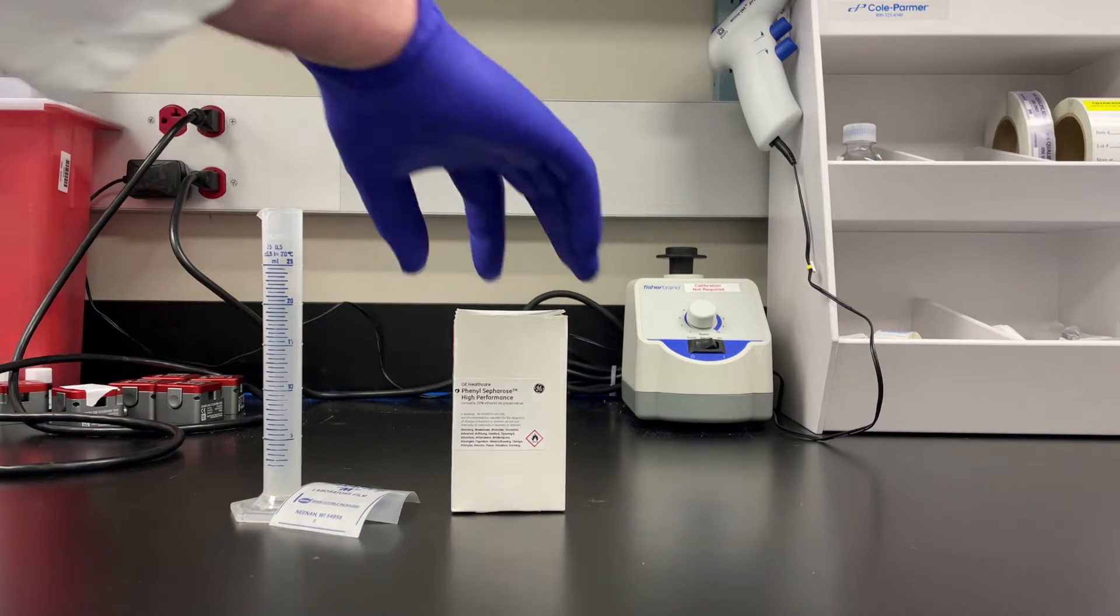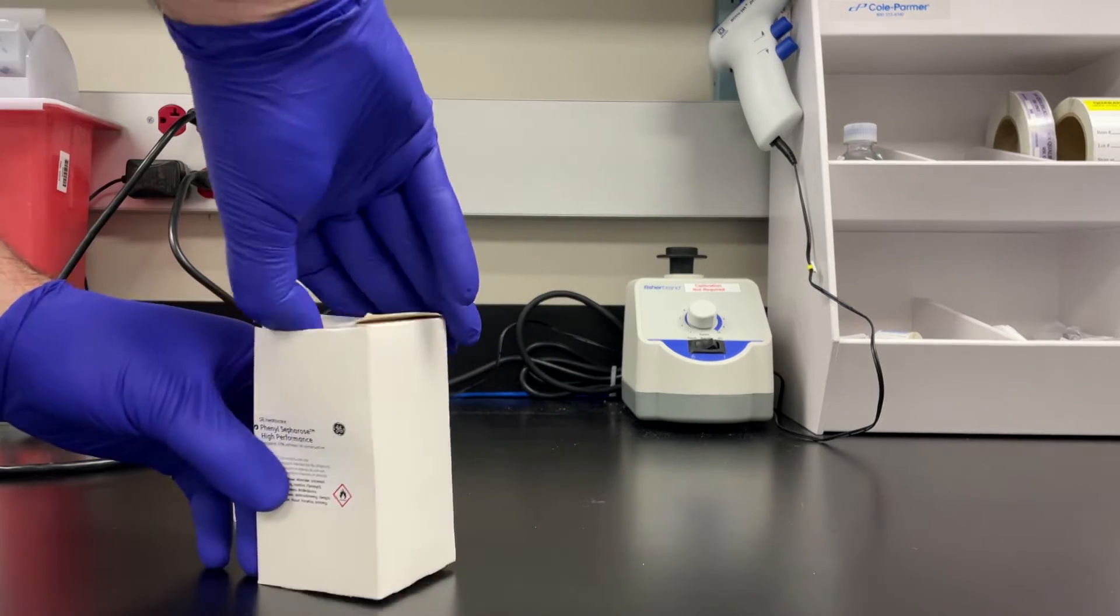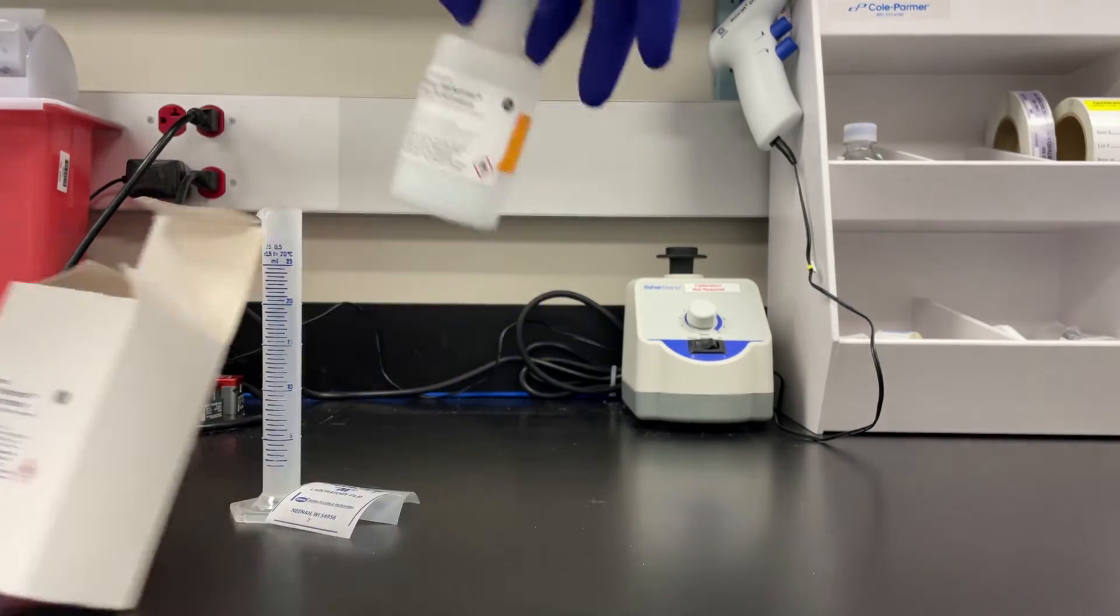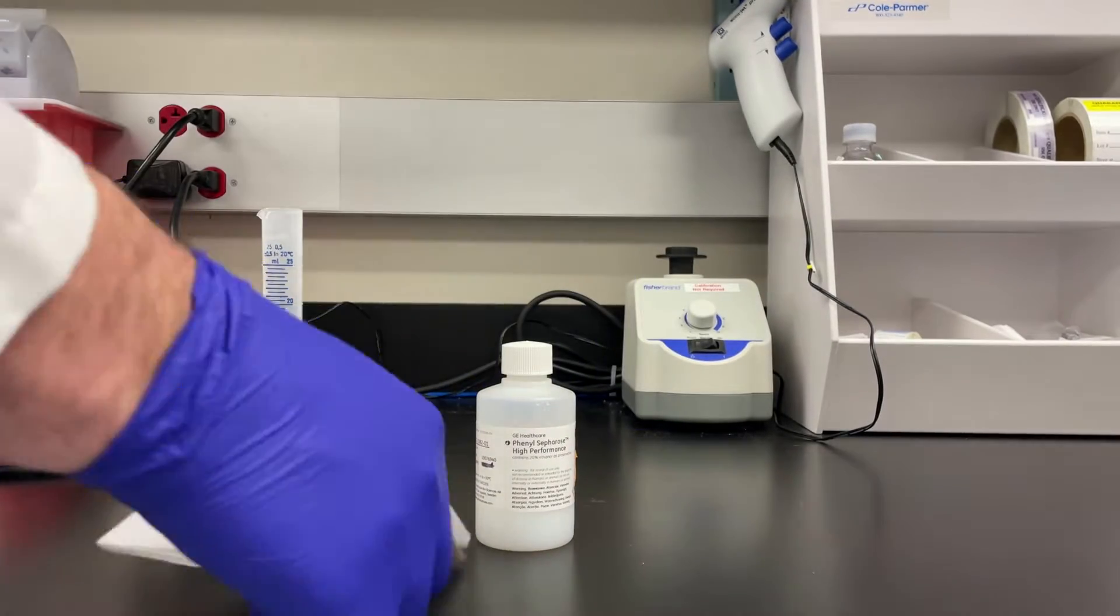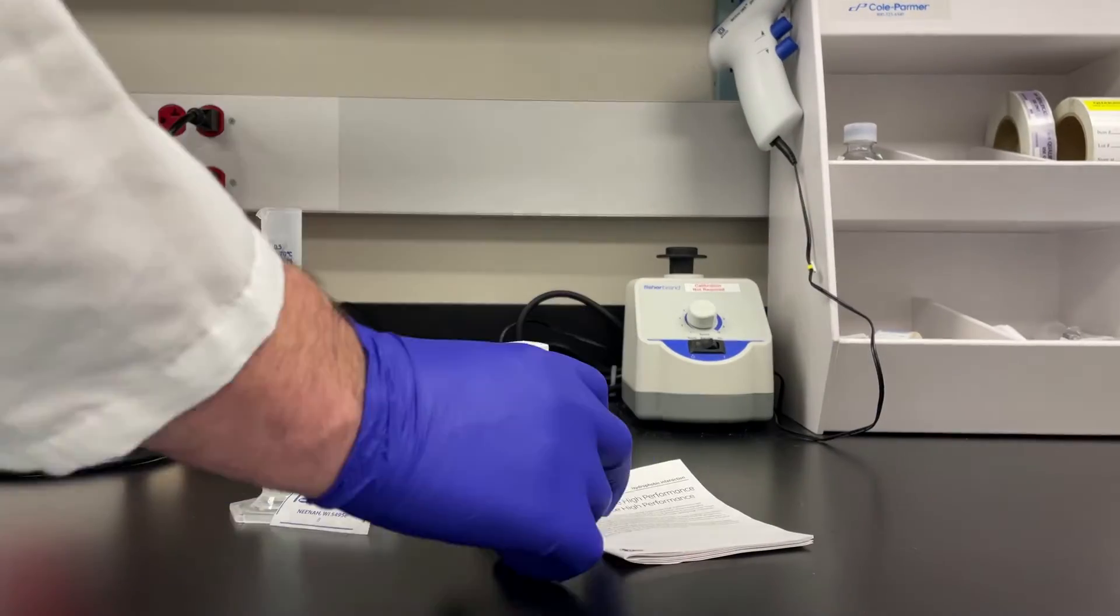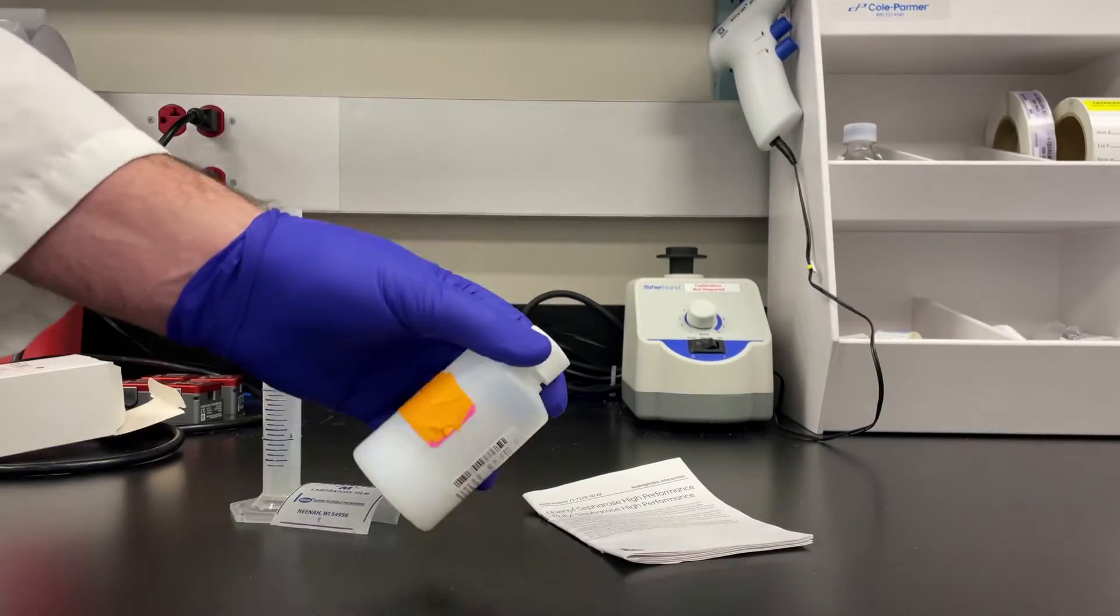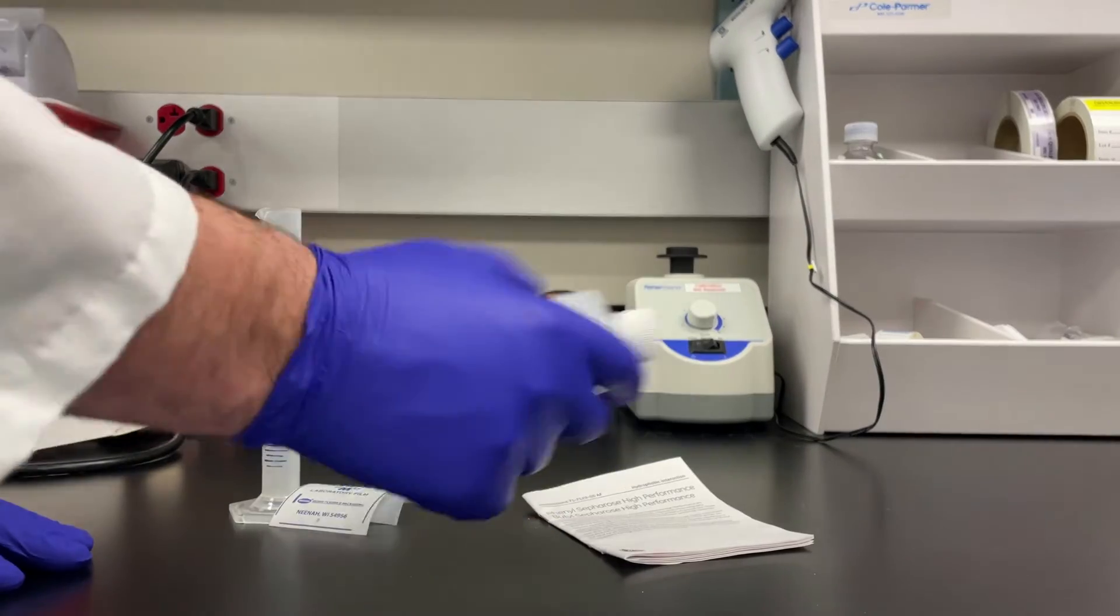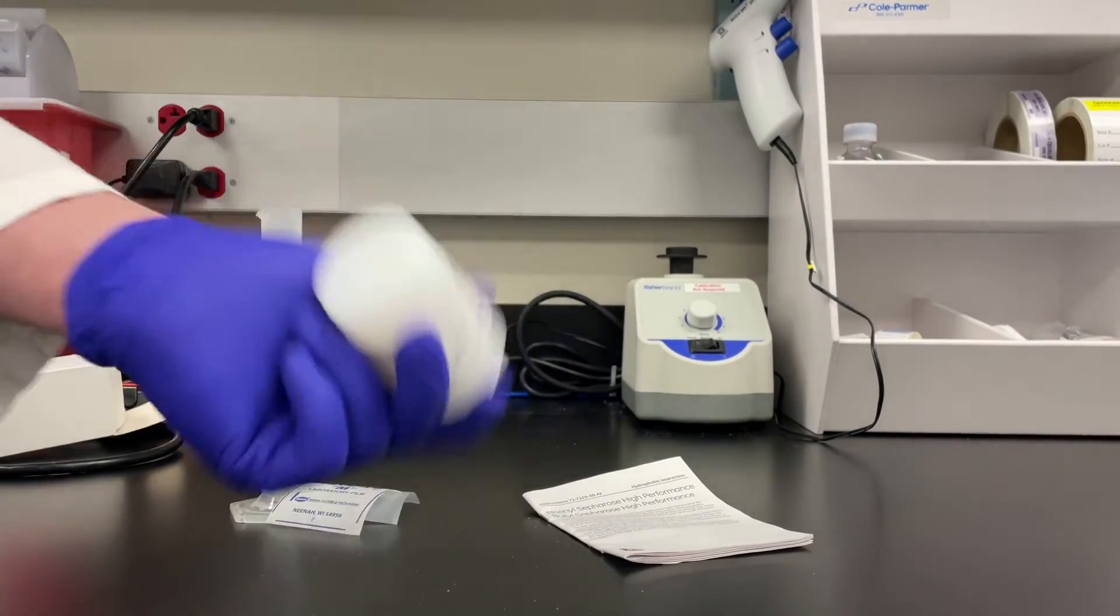This is the finished product. Alright, so the first thing we're gonna do is resuspend this resin. I happen to have a bottle of phenyl HP laying around and I'm gonna resuspend it just by shaking it. Gotta shake it really good. I obviously sped this up.